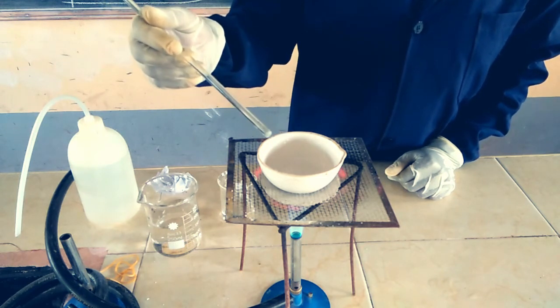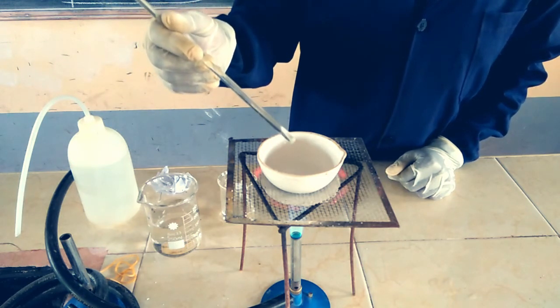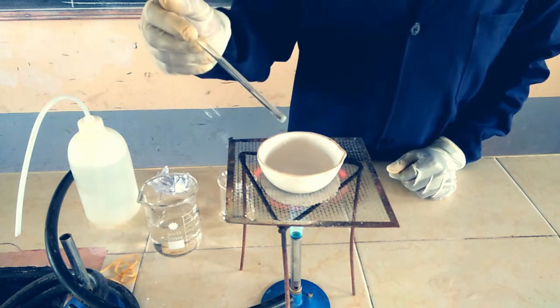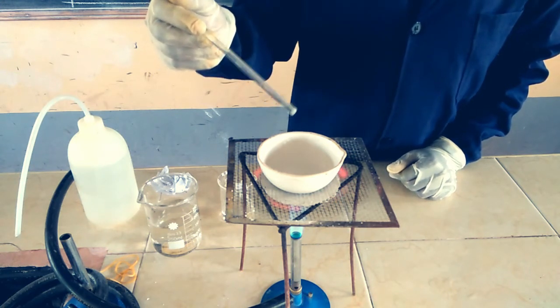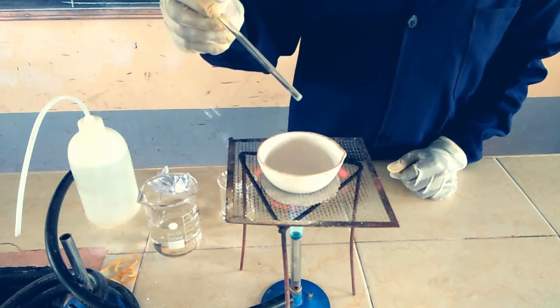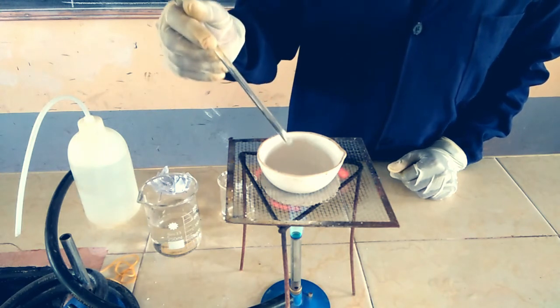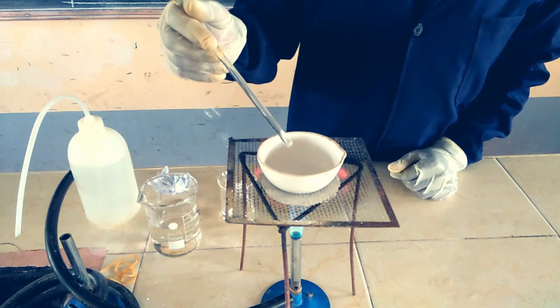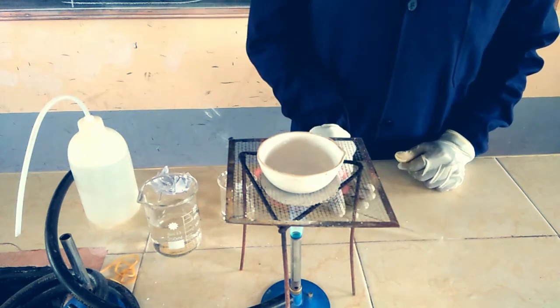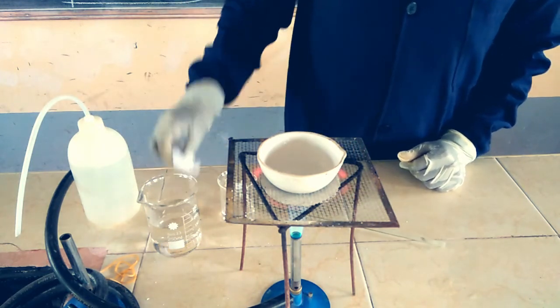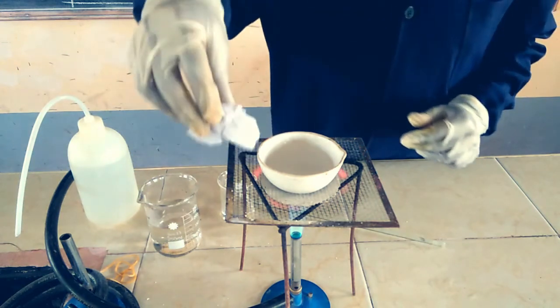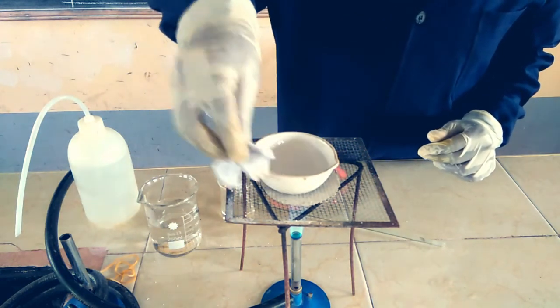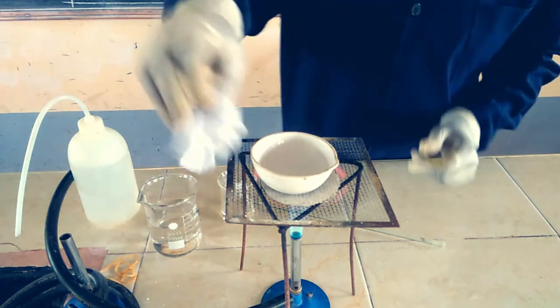Our solution is just about to be ready. I think our solution is ready, so I'm going to remove it from the flame. It's very hot. I'm going to remove it from the flame.